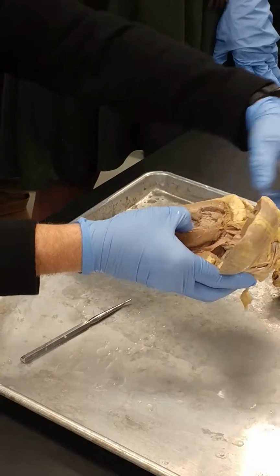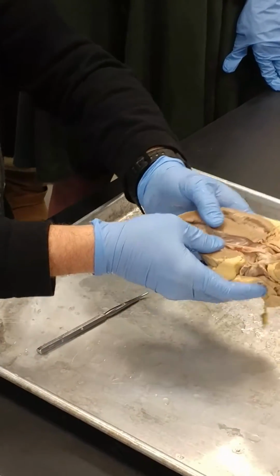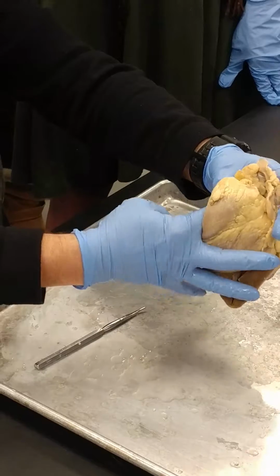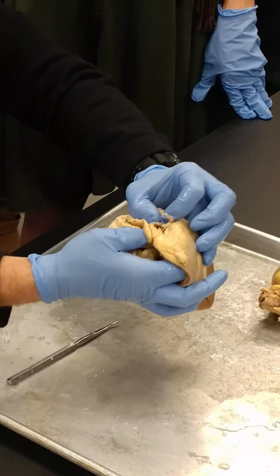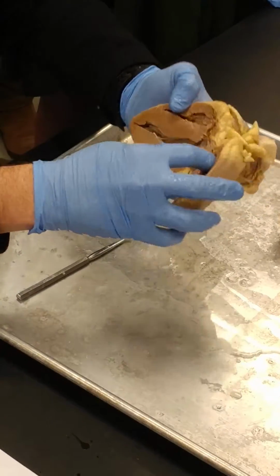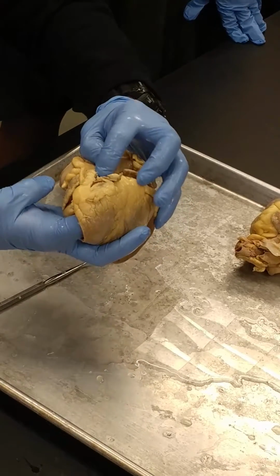So the pulmonary semilunar valve, we got to go back to the pulmonary trunk. So what did I do? Remember, to see pulmonary trunk, I flipped it this way. And I went up inside here to get to the pulmonary trunk. Now they did a good job cutting this, so you can kind of see the valve cusp down in there. Remember, the pulmonary semilunar valve is a semilunar valve cusp. It's not these with the chorda tendineae. So when I come up in here, I'm actually putting my finger through the valve cusp.